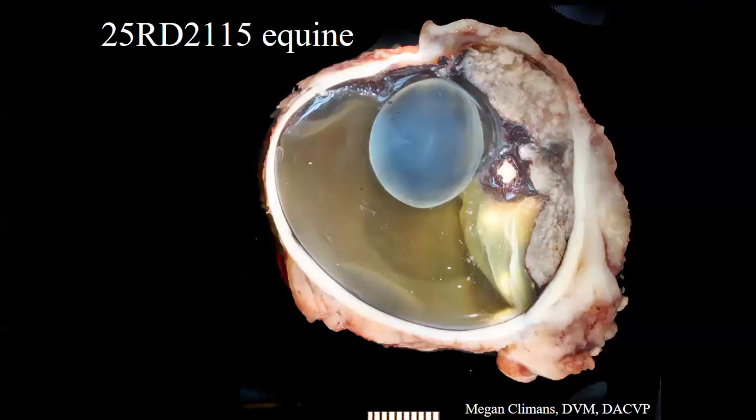All right. So we have our gross view of the eye. The optic nerve head is actually right here. So this is the dorsal eye, presumably, and then the ventral eye is a little bit foreshortened. So we do have a small, maybe shrunken, maybe slightly wrinkled eye, which is part of phthisis. But mostly the distortion is happening because of this giant tumor, which I should probably point out first. It's here in the uvea, so it's in the iris, the choroid, the ciliary body. You can see more of it deeper in the hemisphere of the globe, bulging forward and displacing the retina on top of it. The retina looks like a wedding veil, essentially.